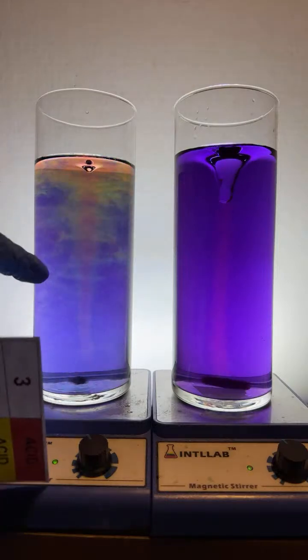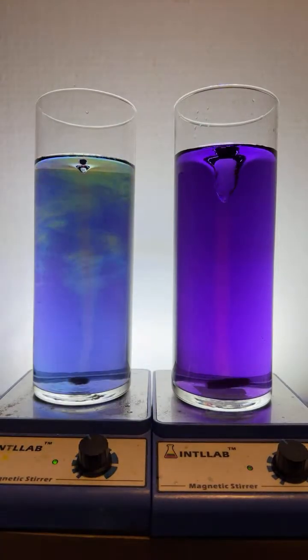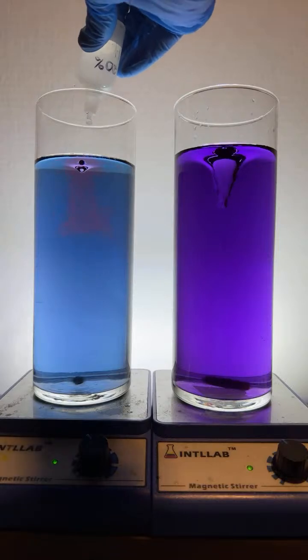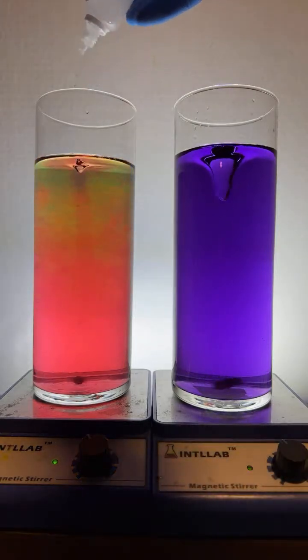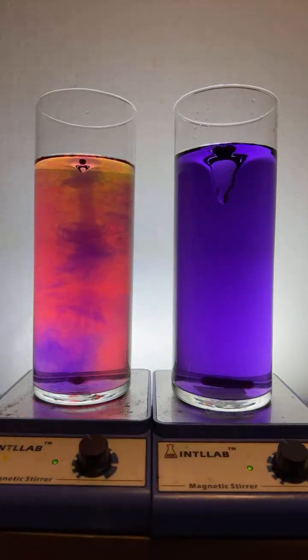I like this one a little better because the colors tend to persist with the smaller stir bar. It's unable to mix things as quickly. If I keep adding those acid and base drops, will the water container eventually break? No, it won't. The acid that I'm adding is benign enough, and it doesn't react with the glass. Hydrochloric acid does not react with glass. Sodium hydroxide does react with glass, but the concentrations that I'm adding are so low that it's not going to affect the glass. I've been doing this for years.